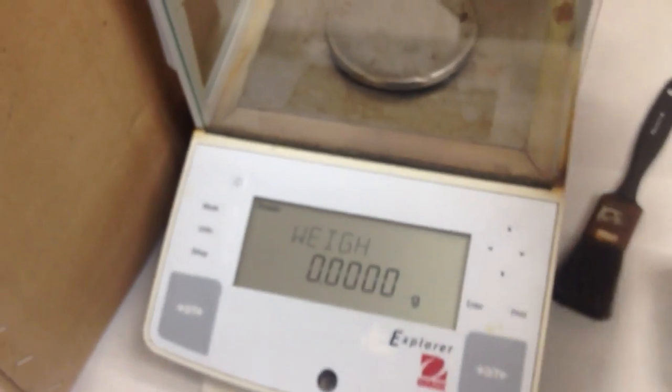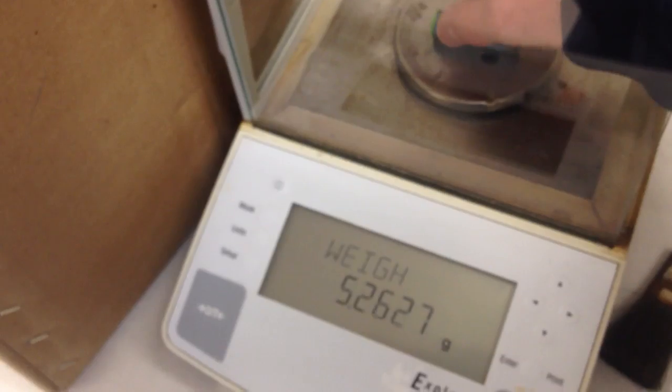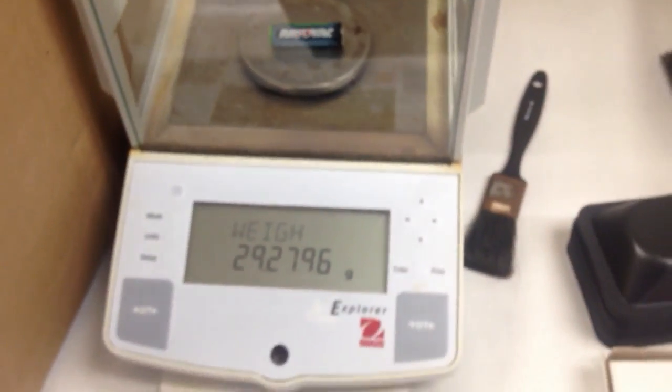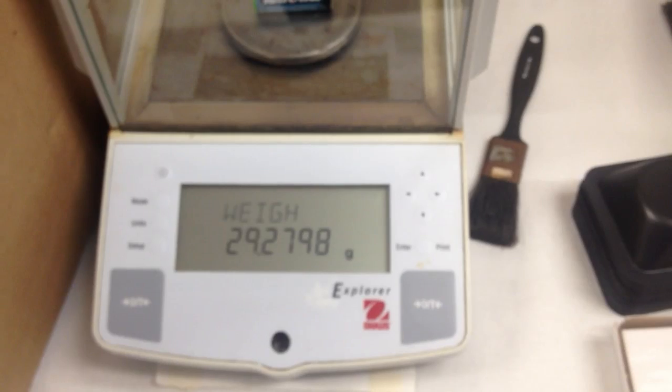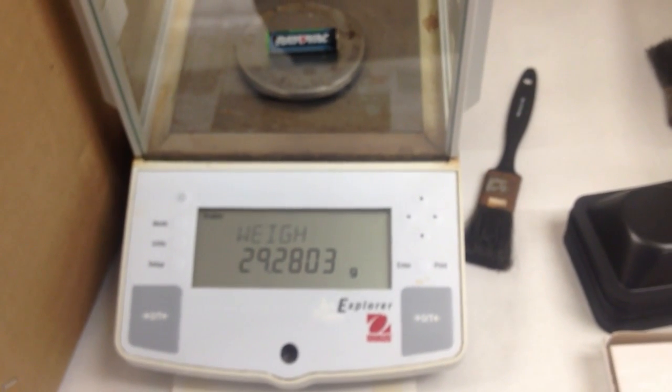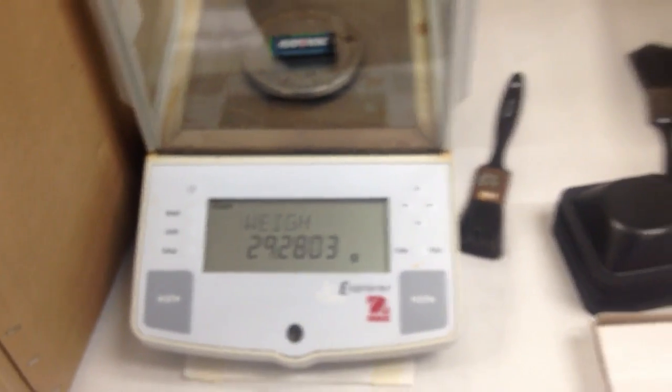Alright, we've got our balance, we've got it tared. Place my battery in there, and I get 29.2803.